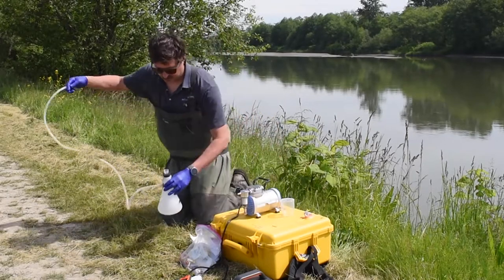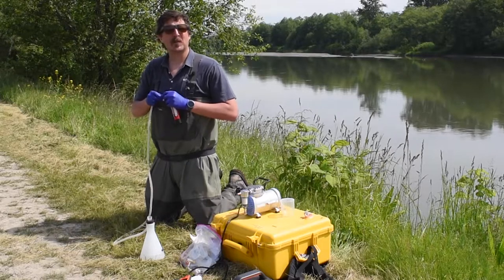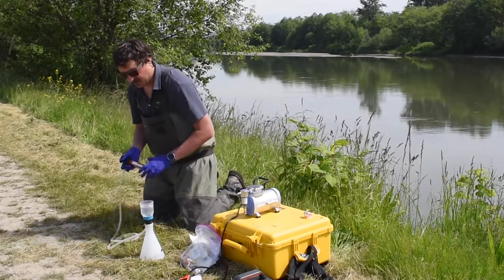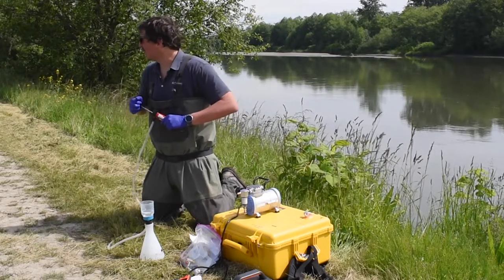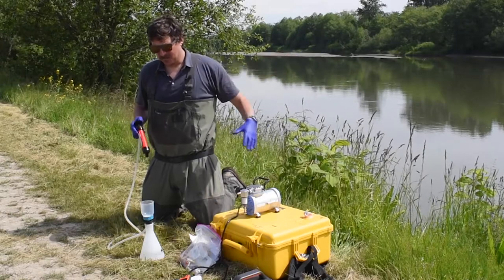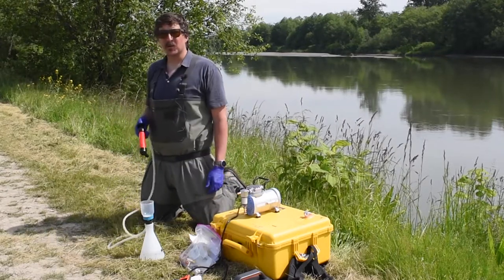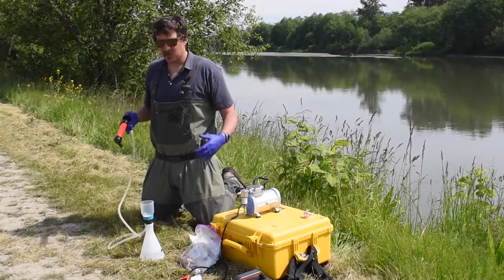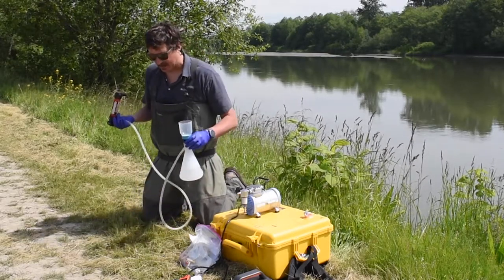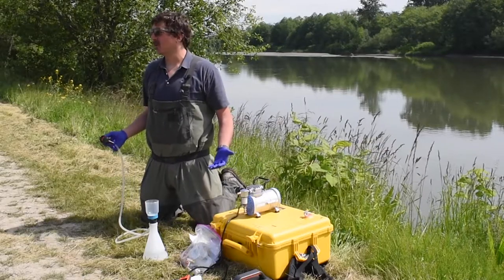This is what we do in the backcountry — a $6 oil transfer pump I bought at Harbor Freight. There's no filter in here right now, but in a backcountry environment it's a little simpler and sleeker. If you're in a place with a lot of sediment further down in the system, it would take probably an hour to pull a full sample. But when Nicole and I have been up in some really extreme headwater areas with pretty clear water, it's a really efficient tool. It's lightweight, fits easily in a backpack, and the process for pulling the sample out is the same.